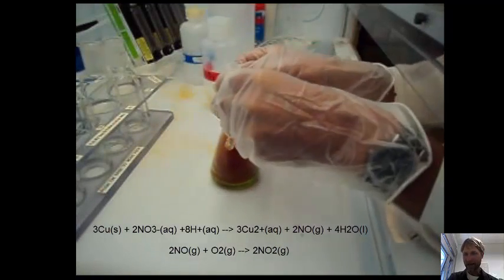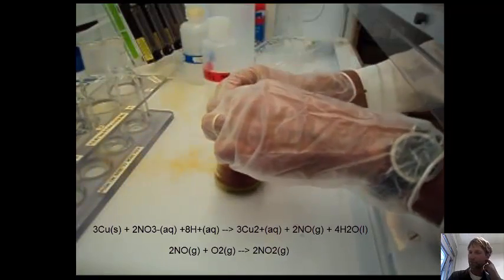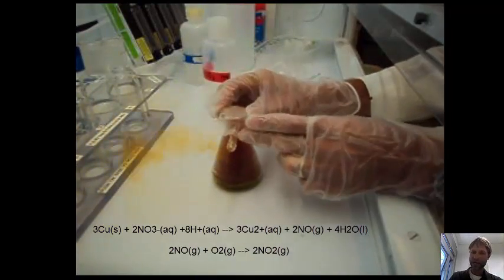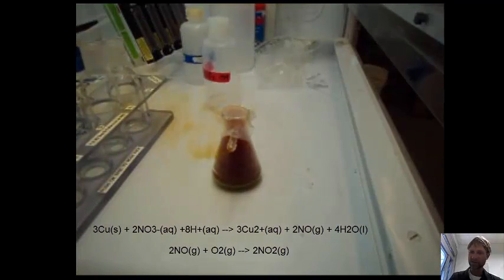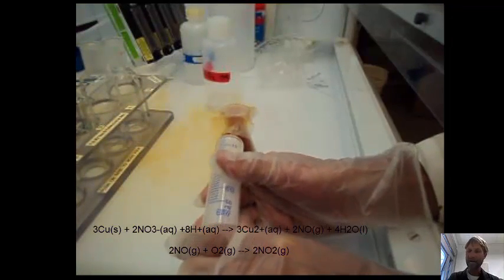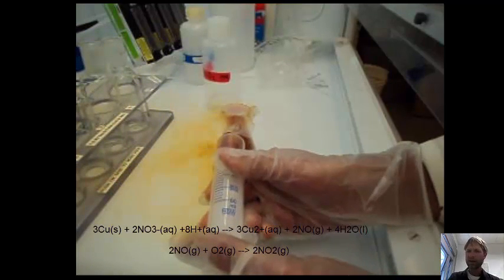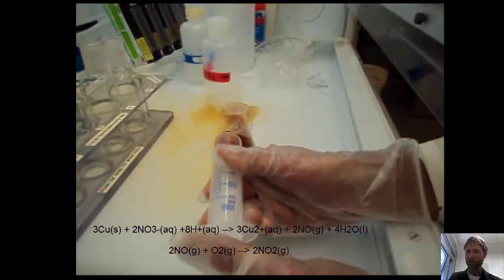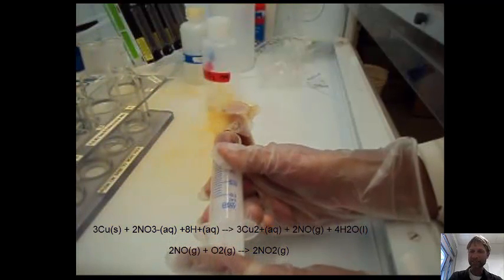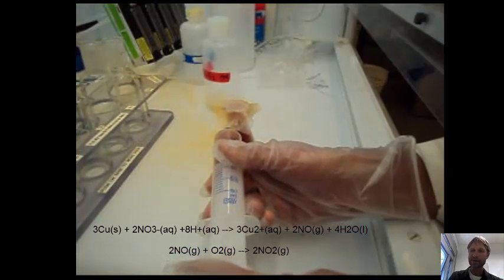Now the NO rapidly reacts with oxygen in the atmosphere, O2, producing NO2, according to the lower reaction. What I'm doing here is capping the top of the flask so that most of the NO, which is now NO2, comes out the sidearm. And from the sidearm, I'm attaching a syringe to put some of what is now NO2 in the syringe.